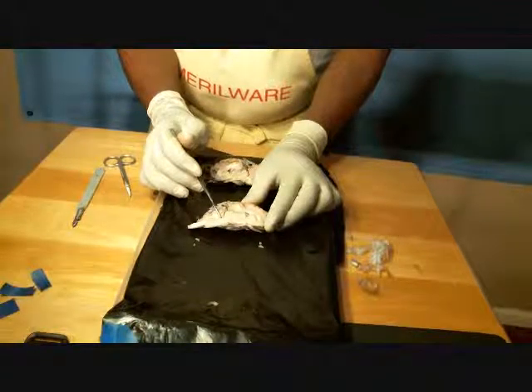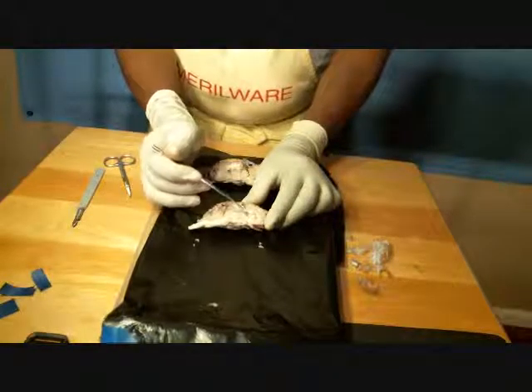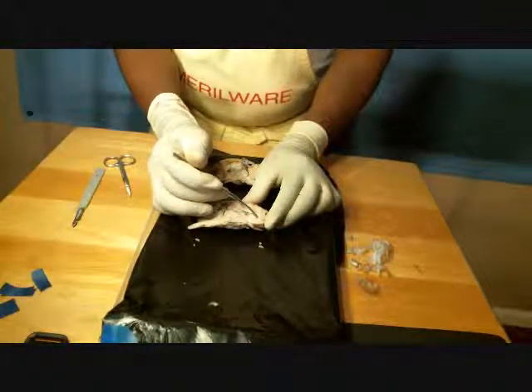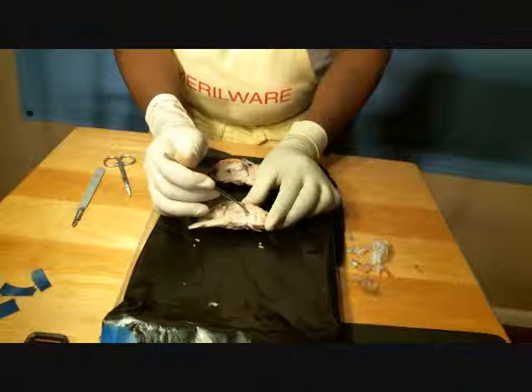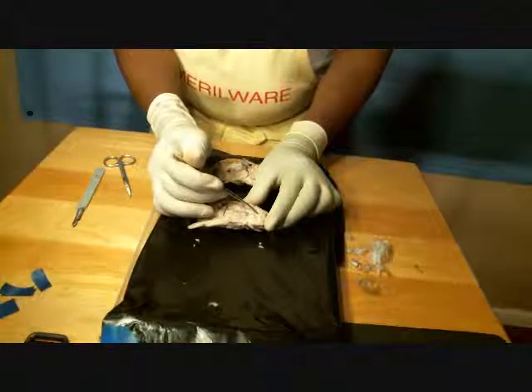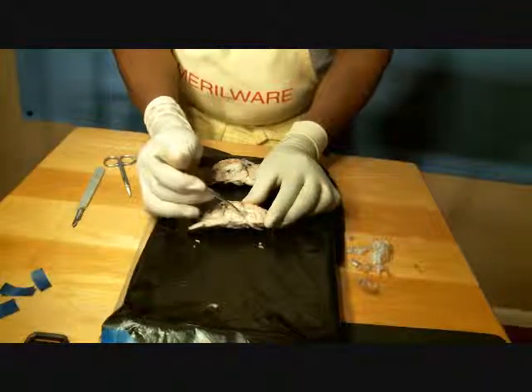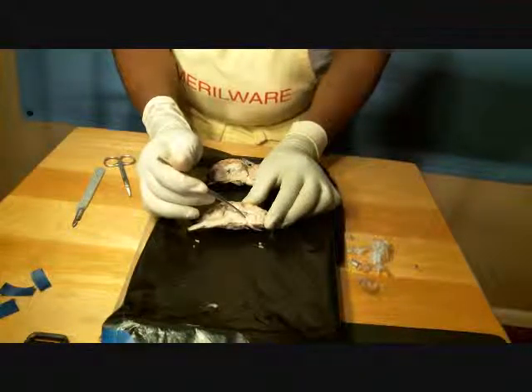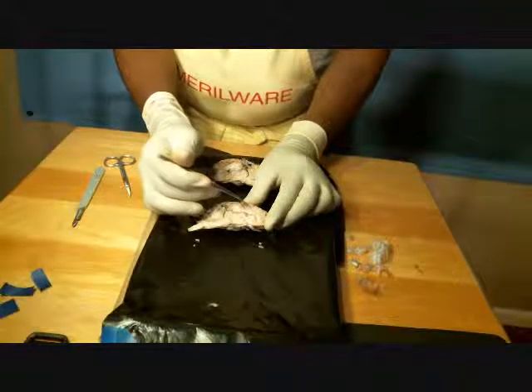As I come to this side, again, the structures that are easily visible. I have my corpus callosum, which is this white strip running right through here. I have my lateral ventricle inside of it here. I'm not exactly sure where to point at where my fornix comes together at, but I believe it's somewhere over here. The cerebrum, again, up at the top.